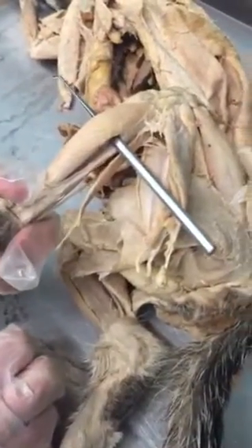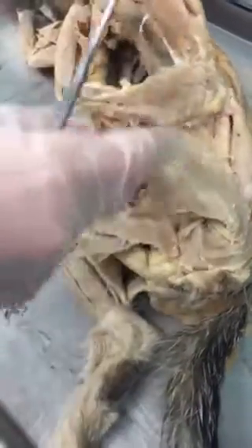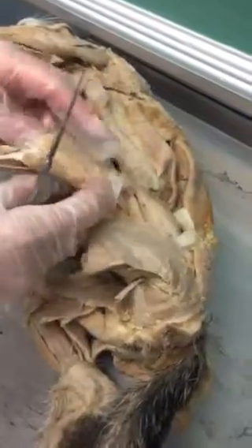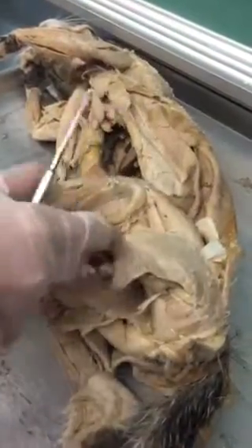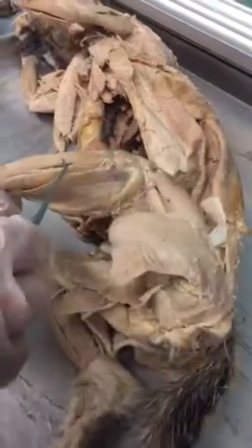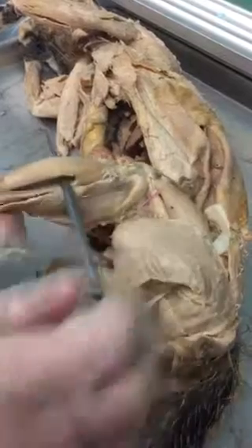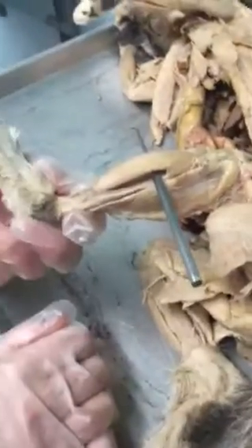there's no muscle, it's just bare bone. But on the anterior lateral side of the tibia is the tibialis anterior, and that dorsiflexes and inverts the foot. So again, the muscles in the back of the leg, the calf muscles, are the gastrocnemius, the plantaris, and the soleus. Those are the ones we just did last week. And the muscle on the front of the leg is the tibialis anterior. Those are all the muscles. Great. Amazing. Okay?